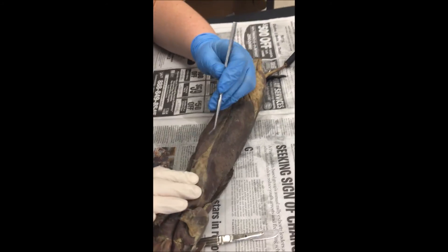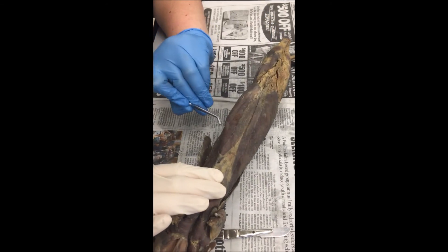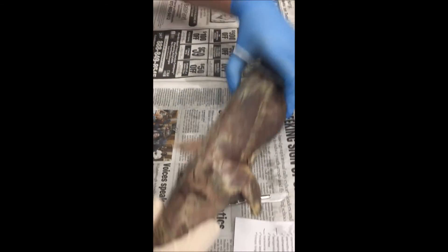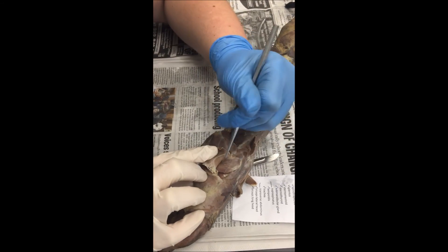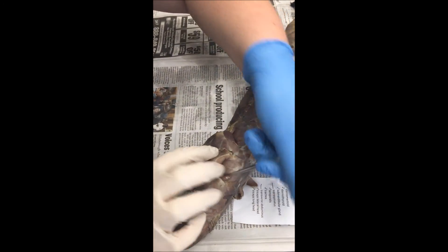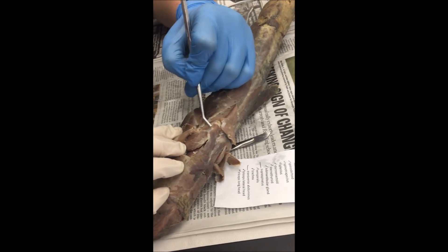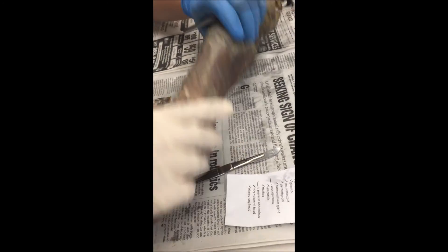Rectus abdominis, transverse abdominis, supraspinatus, and then below that is the infraspinatus.